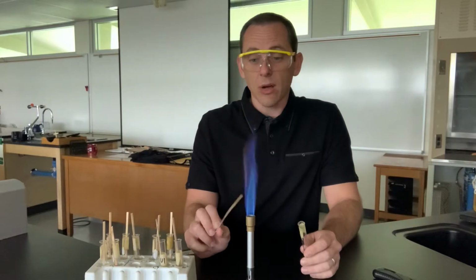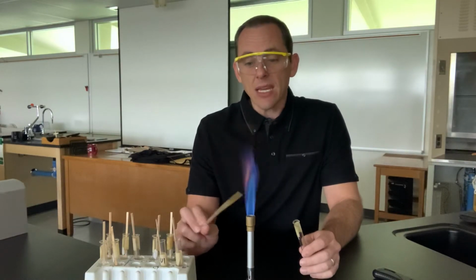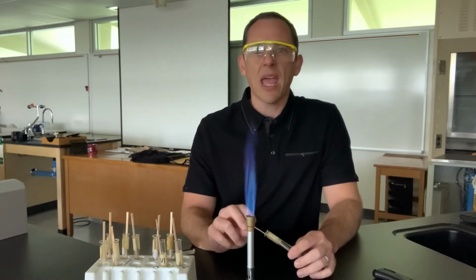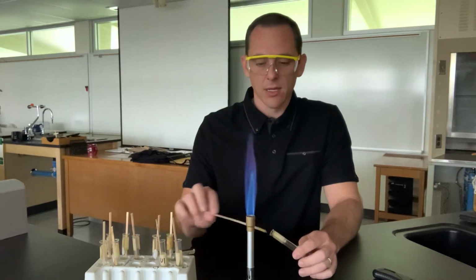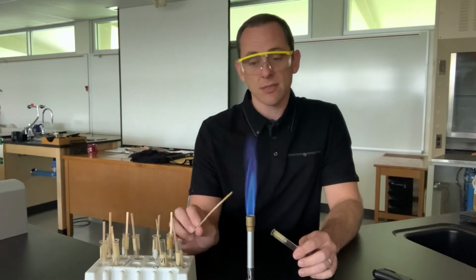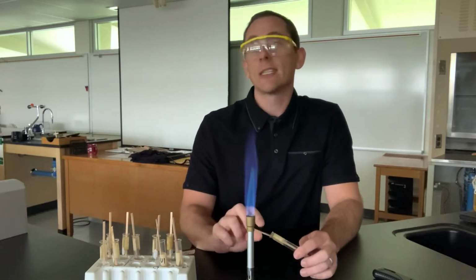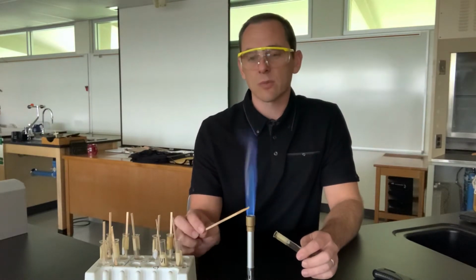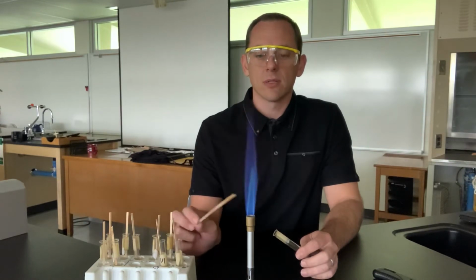We remember that we call this a qualitative observation. Okay, so for me, I would call barium sort of like a pale yellow. That would be how I describe it. But if you want to call it by something else, if you want to come up with some fancy name, sunshine or something like that, then that's fine with me too. But this is what we're seeing for barium. It's kind of like a pale yellow color.